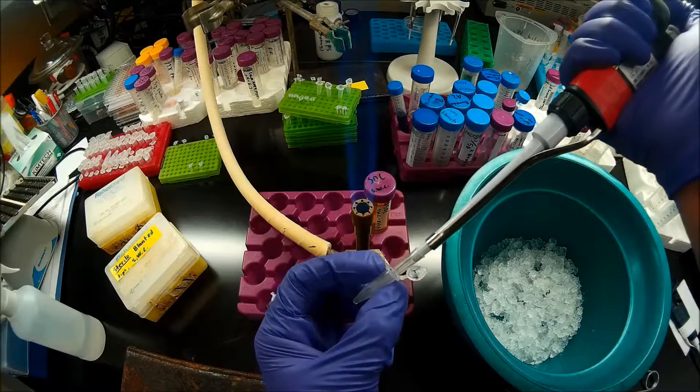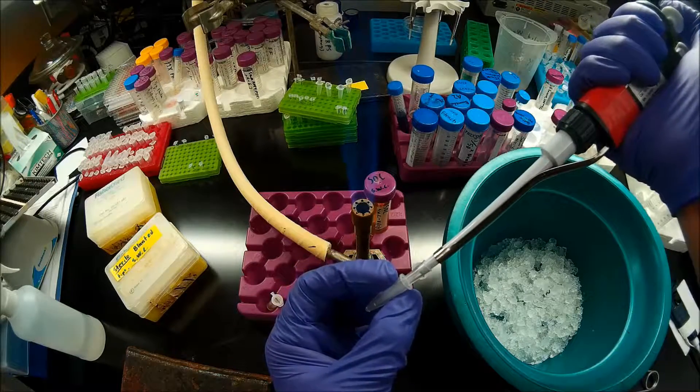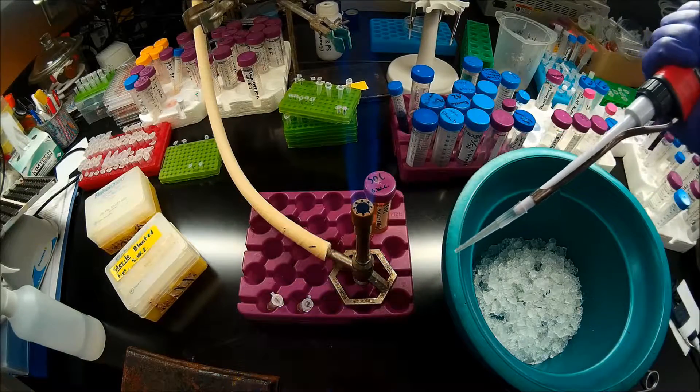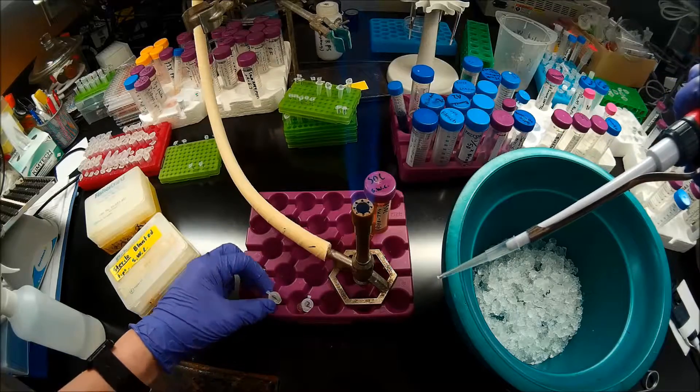So pipetting them, the shear that you exert on them by pipetting them, can disrupt the cells. So to avoid that, I'm using blunted pipette tips.